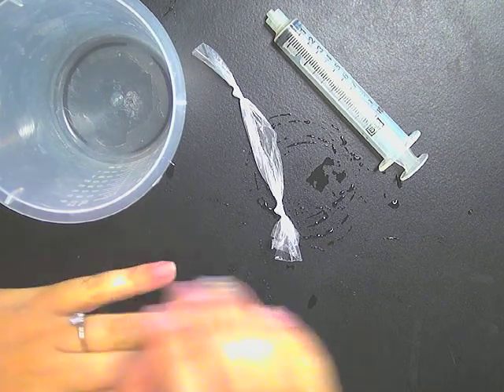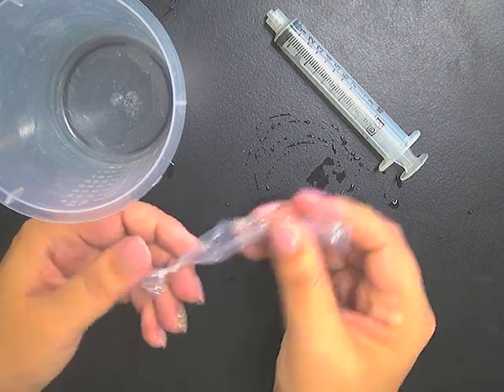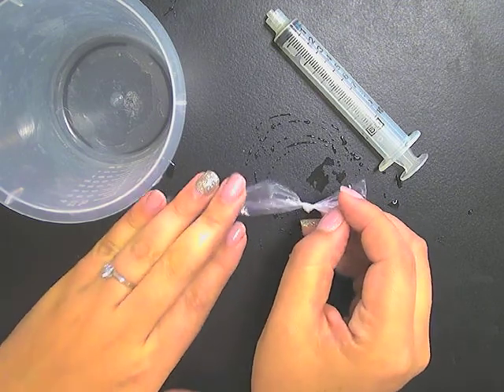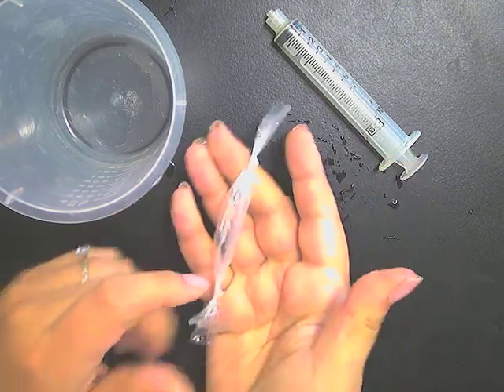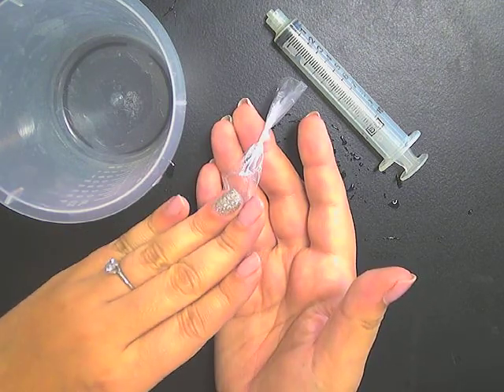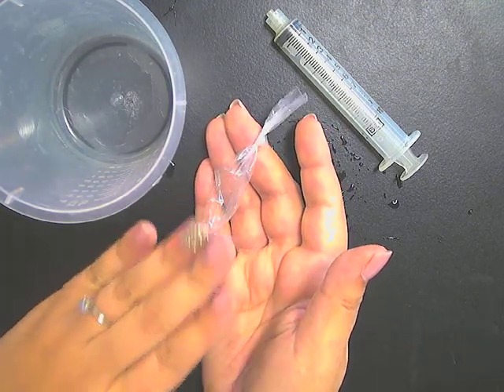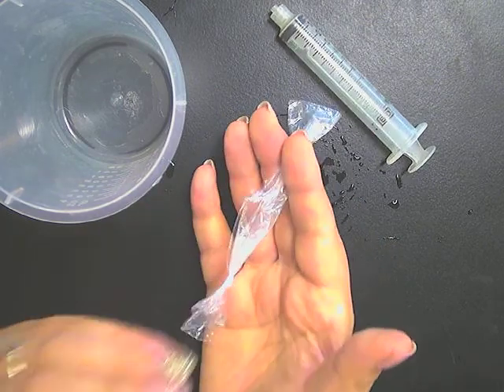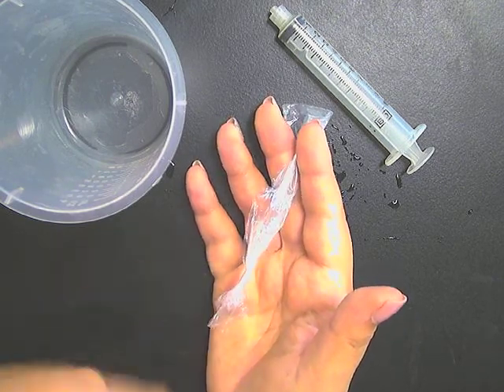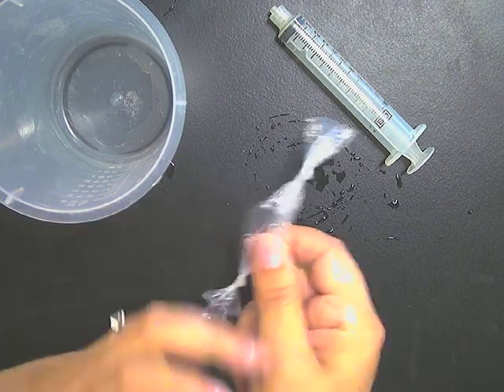So how will you know what the molarity of your solution is? You're going to be put into a group with other students that had different color solutions than you did. Then you're going to need to compare how much your solution sausage changed, what your percent change was versus the others. The idea is the higher the molarity of your solution, the most change in mass you're going to see with that particular color. The opposite, the least molarity, will have the least change in mass, not including the control, which should be at 0.